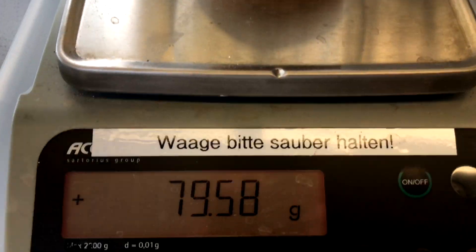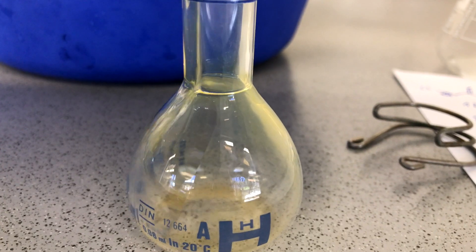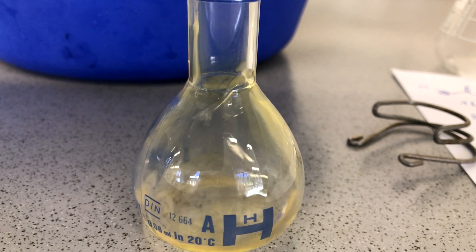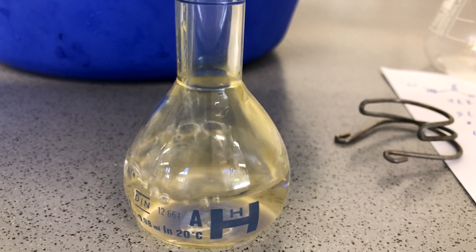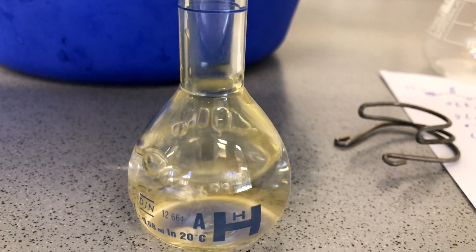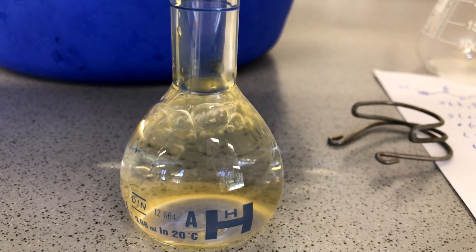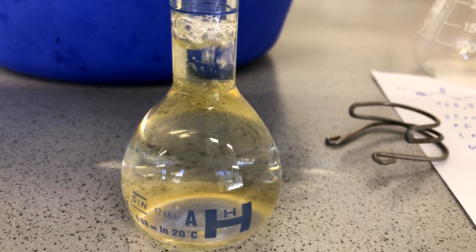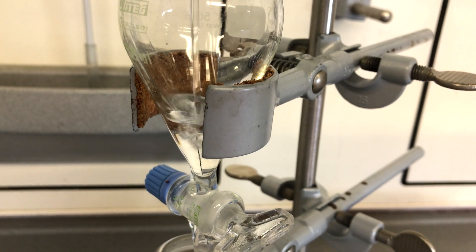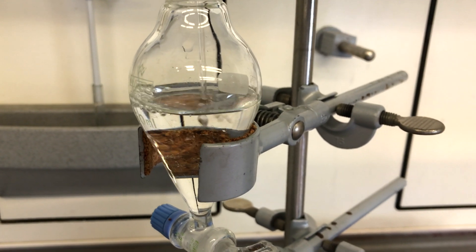If you are wondering where the strange amount of ethylchloroacetate comes from, I added it to a flask, weighed it out and calculated how much ammonia we needed. I used a very small excess of ammonia, but this is not a good idea. Too much ammonia will lead to the formation of glycine and not to chloroacetamide. A small excess of ethylchloroacetate would be ideal.